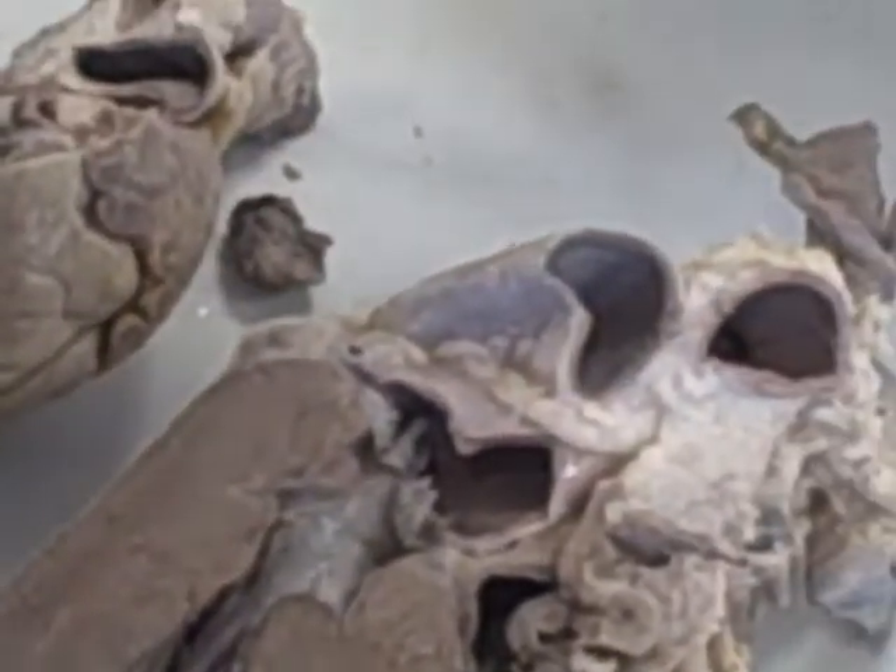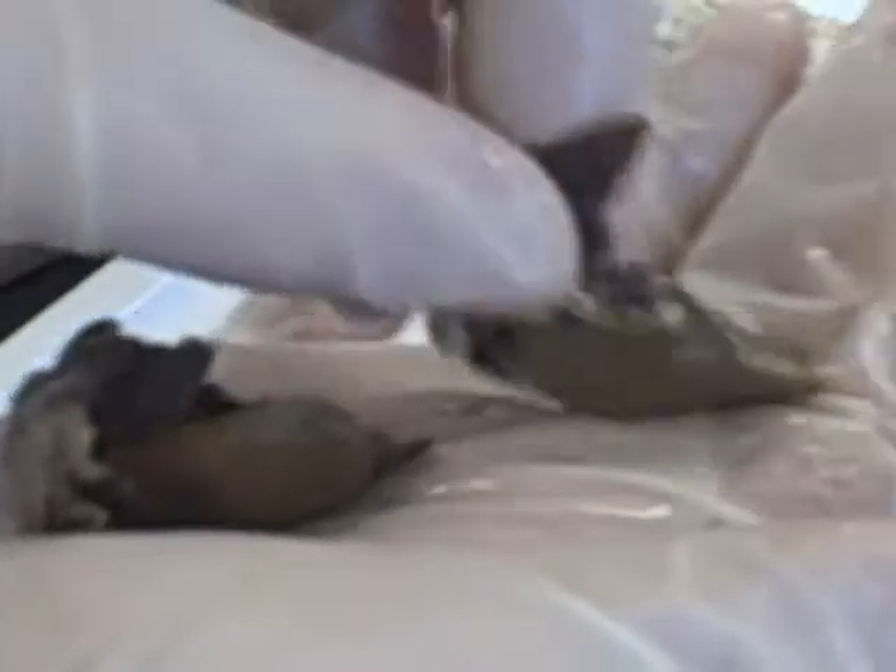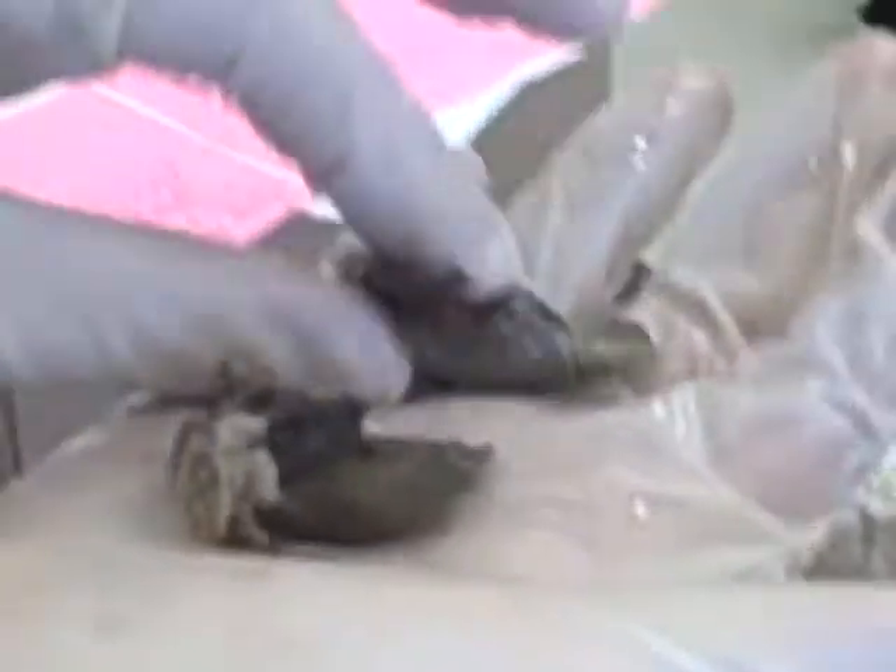For the frog heart, we have it in two halves. It has been broken apart, and it has not been indicated whether this was by design or by accident.